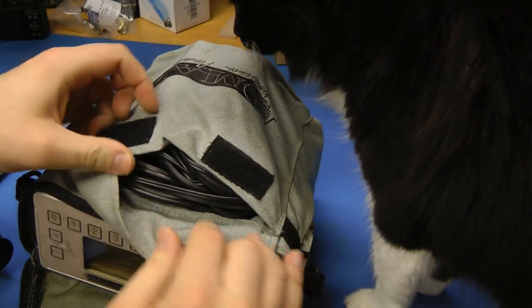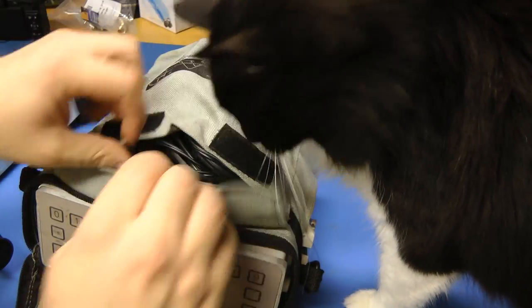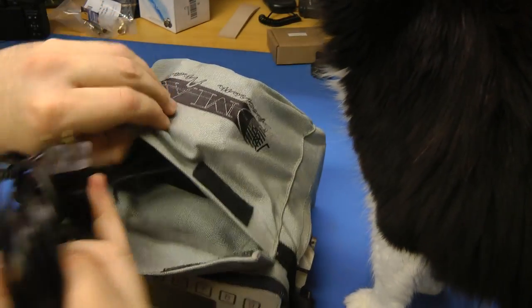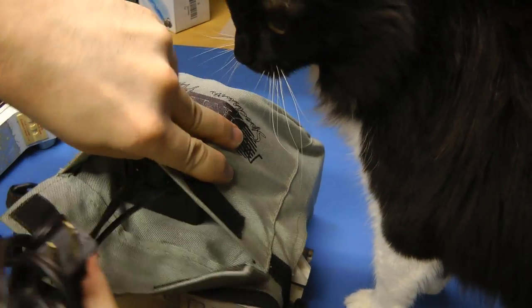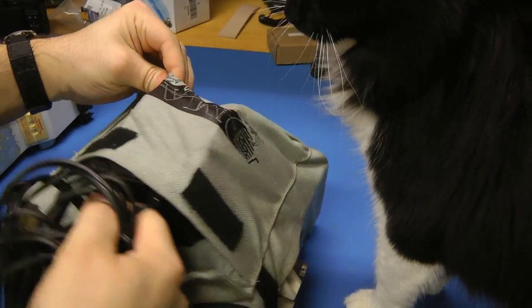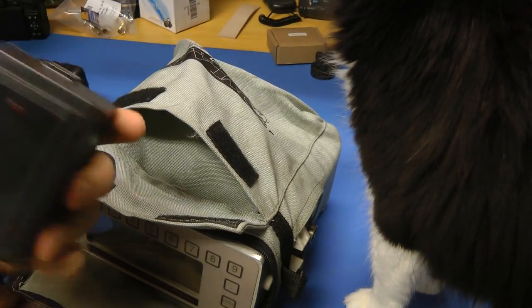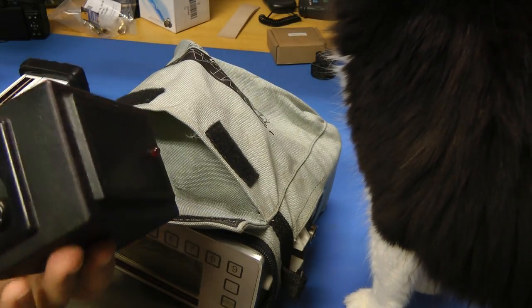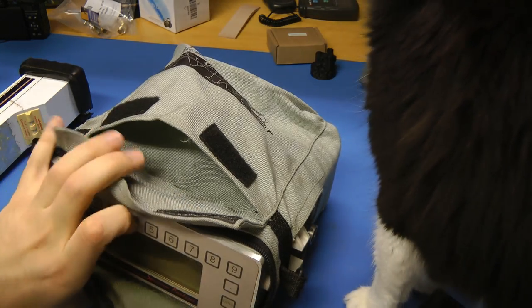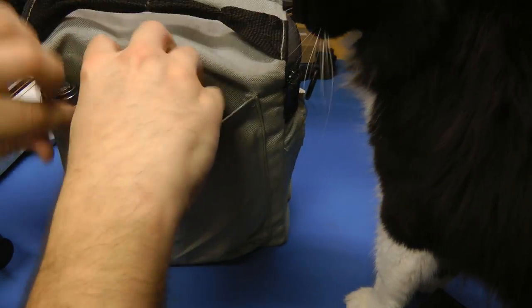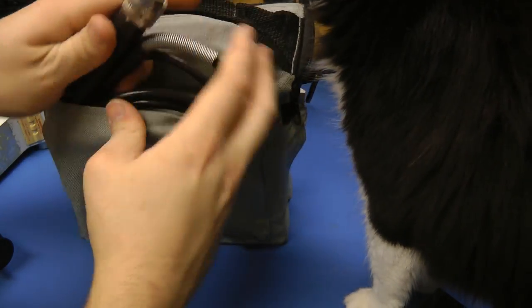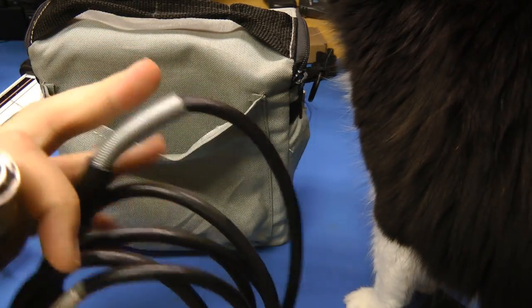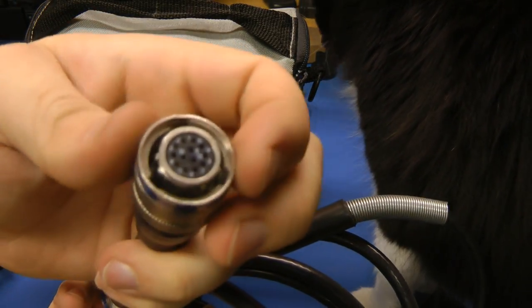It comes with, oh hey Trixie, comes with a power supply, good old conventional 60 hertz transformer. And on the other side, there's just a very, very expensive cable with very nice circular connectors on the end.